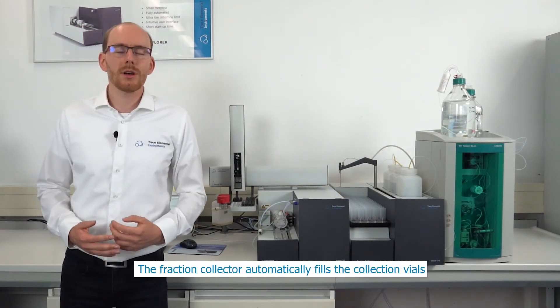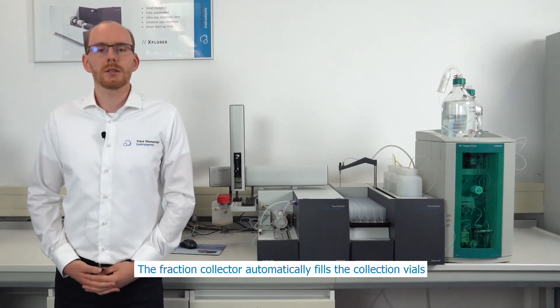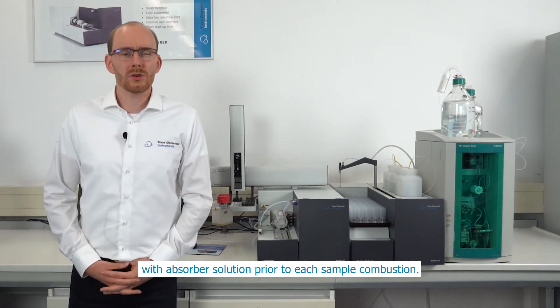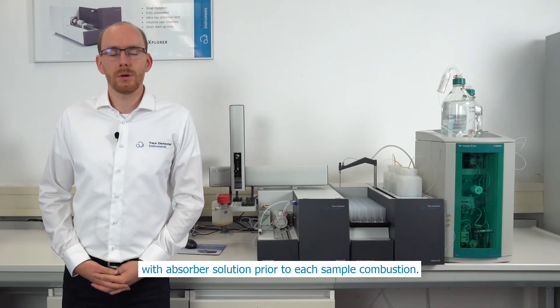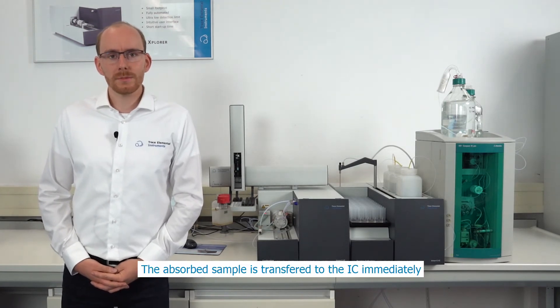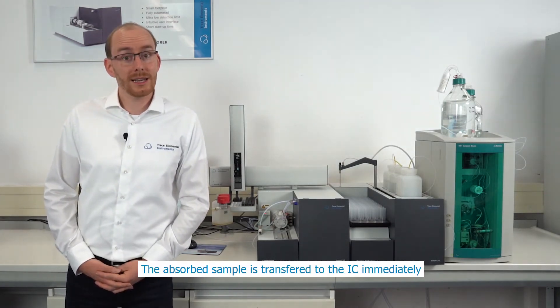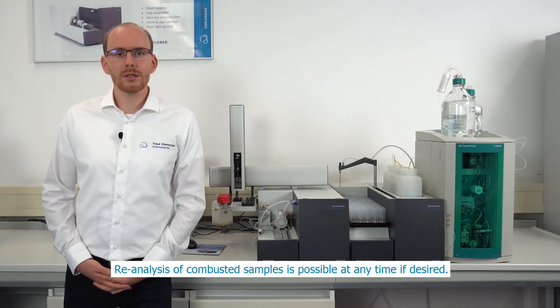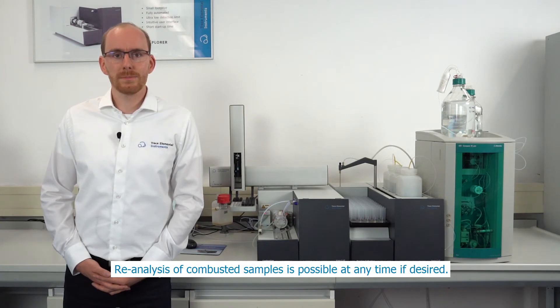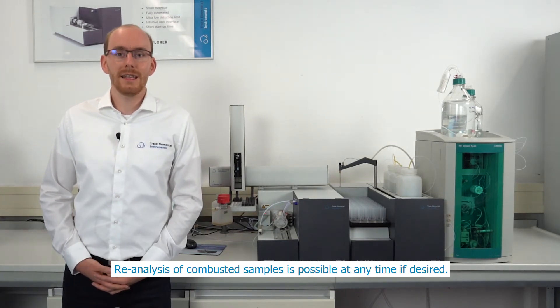The fraction collector automatically fills the collection vials with absorber solution prior to each sample combustion. The absorbed sample is transferred to the IC immediately or stored for later analysis. Reanalysis of a combusted sample is possible at any time if desired.